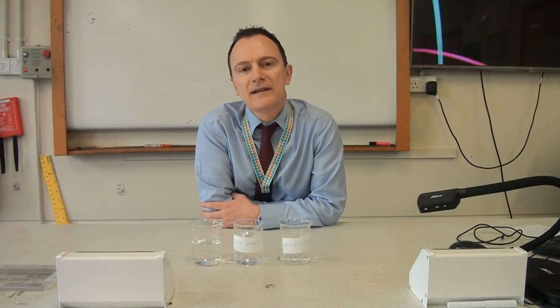So today we've seen how we can use evaporation to leave behind any dissolved salts that may be in a sample of water, and we've also seen how you can use simple distillation to purify that water sample.